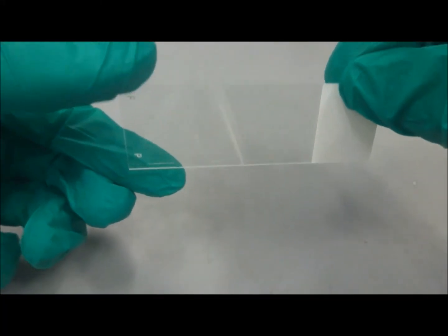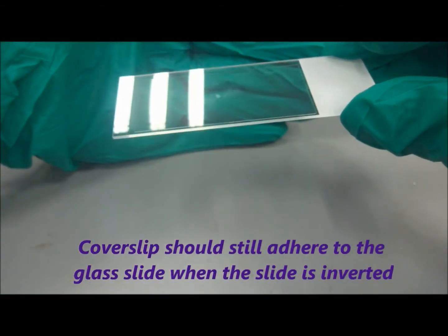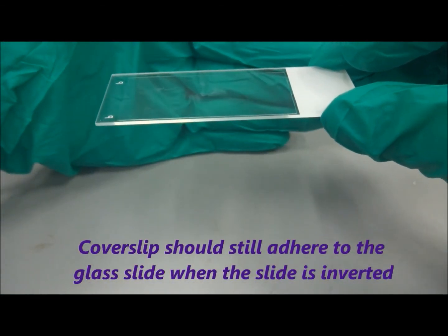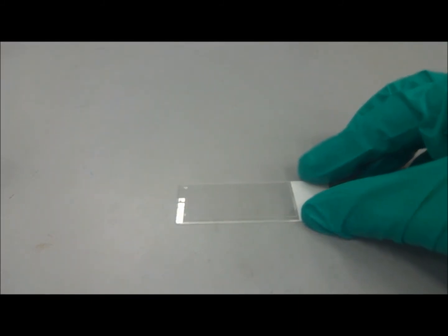Even if you invert the glass slide, the cover slip should still adhere to the slide. The bacterial slide is now ready for viewing with the microscope.